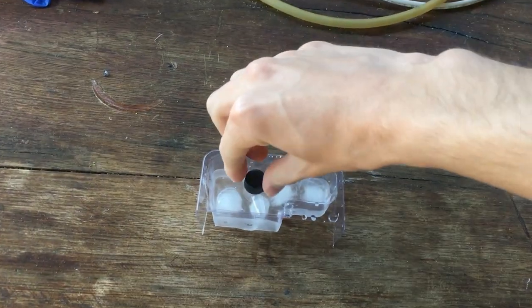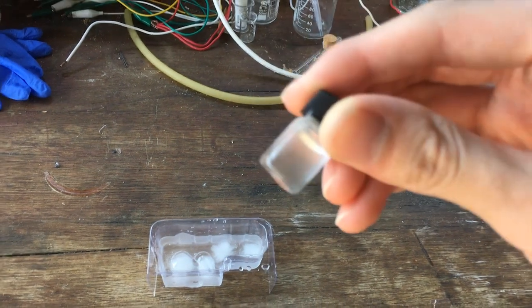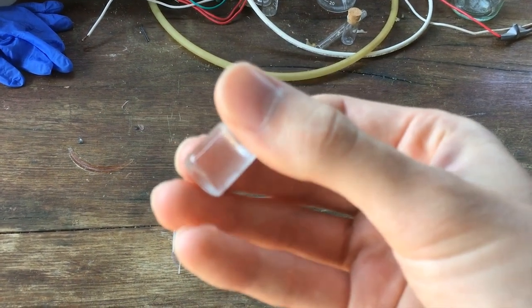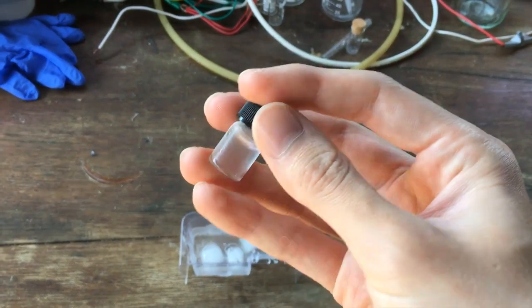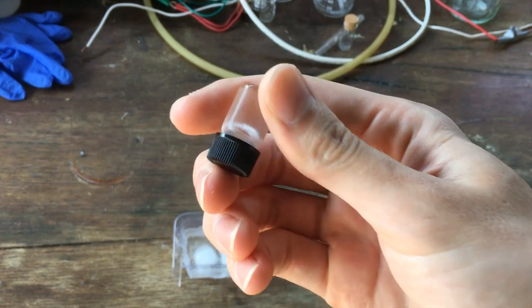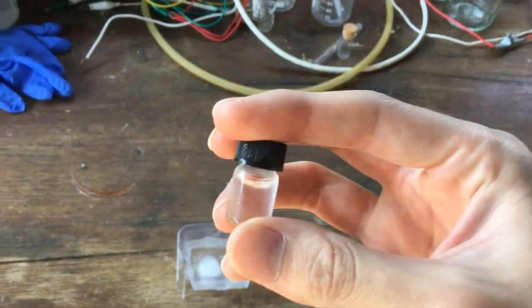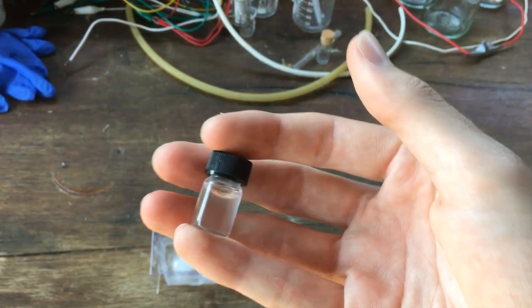And after quite a long time of waiting, we pull out the sample of heavy water and we can see that it is frozen solid. If the camera would bloody focus. There we are. So this conclusively proves that what's in this vial is actual heavy water. The eBay seller hasn't ripped me off, so that's good.